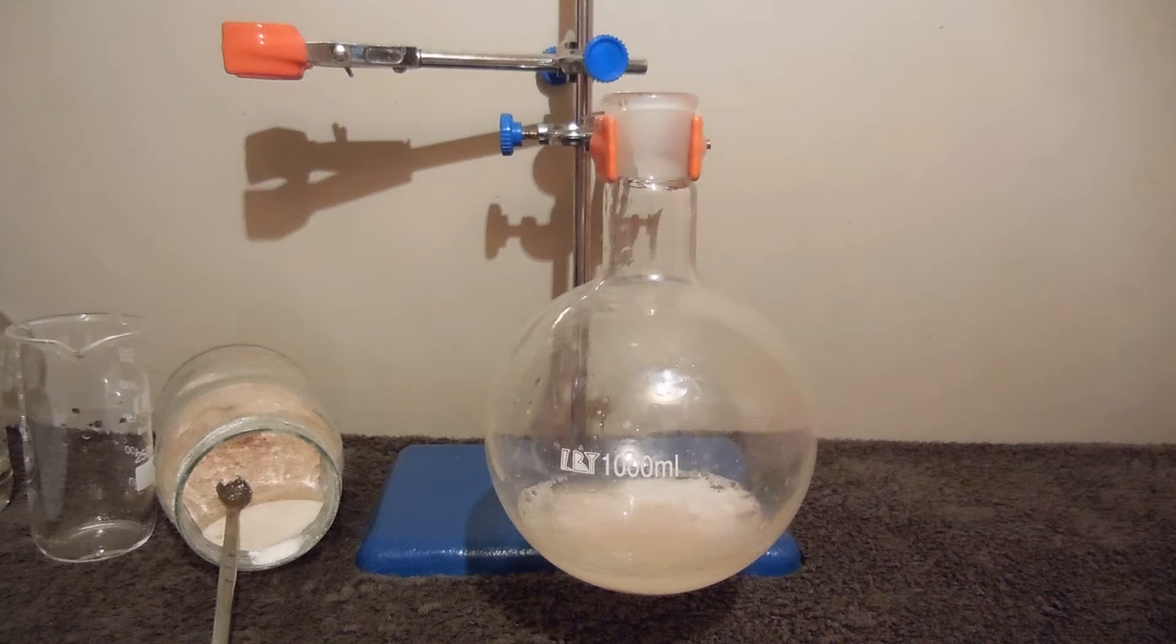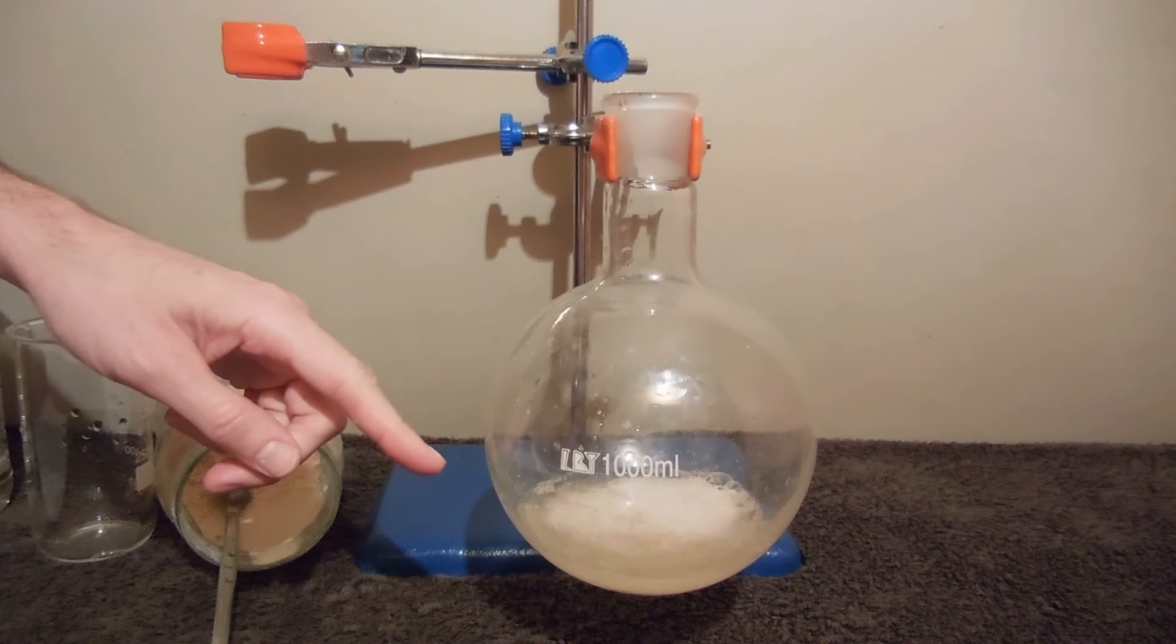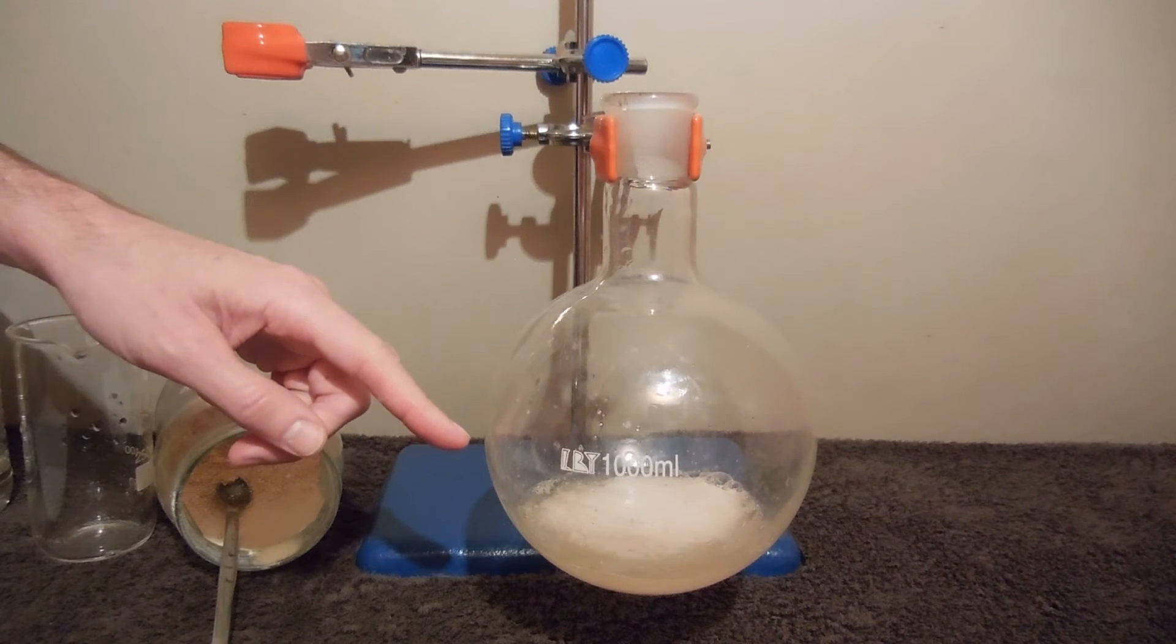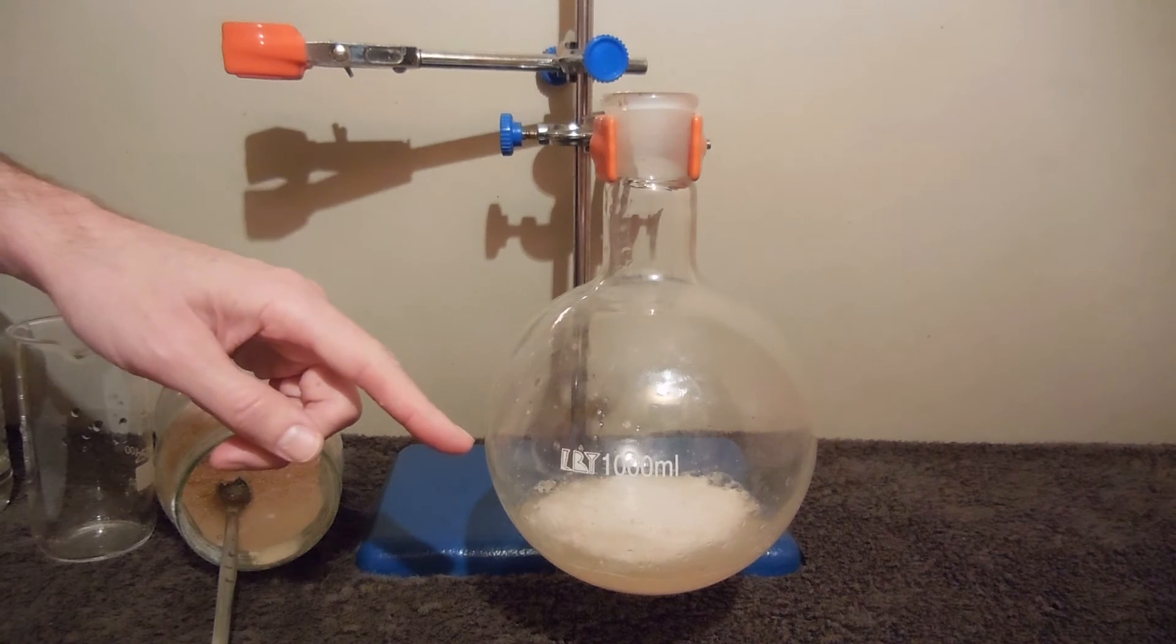Please notice that there are appearing bubbles of carbon dioxide. Plenty of carbonates react like this with acetic acid and other acids.